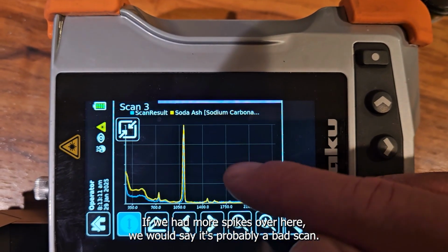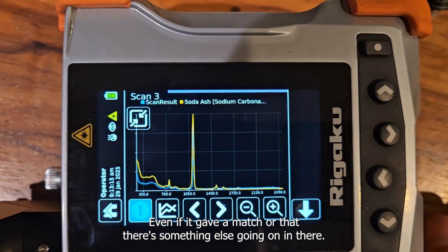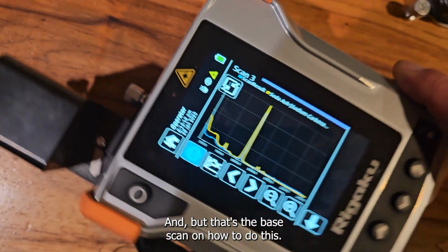If we had more spikes over here, we would say it's probably a bad scan, even if it gave a match, or that there's something else going on in there. We need to do some more investigation. But that's the base scan on how to do this.